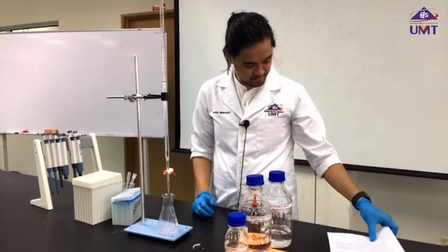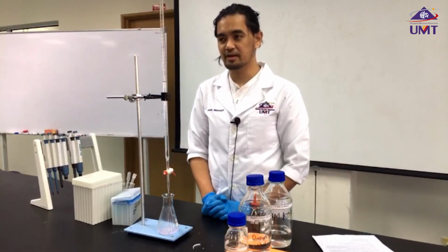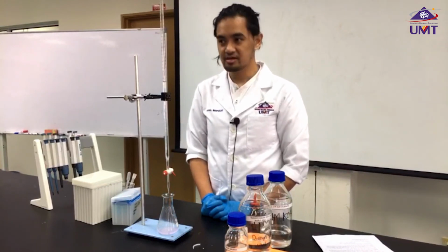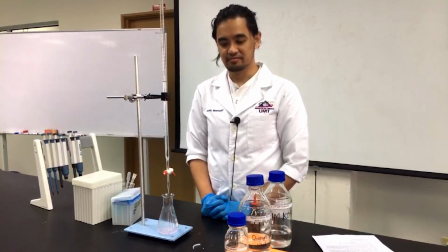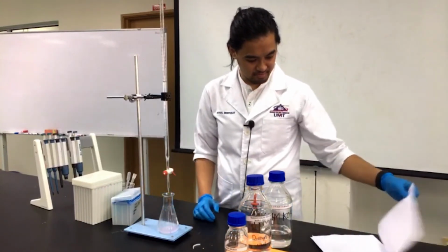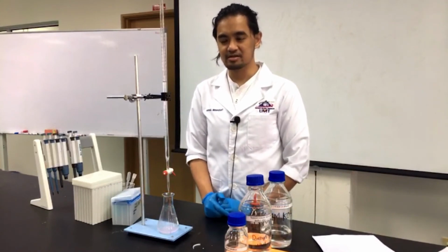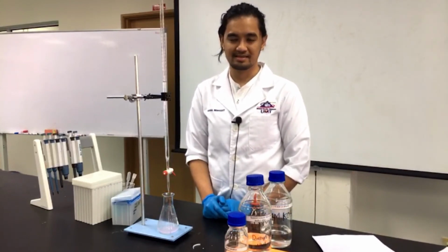From here, we need to calculate using the equation that has been given in the lab manual. So it is your task to determine the concentration of your free fatty acid based on my experimentation. And please answer all the questions given in the lab manual. Thank you.